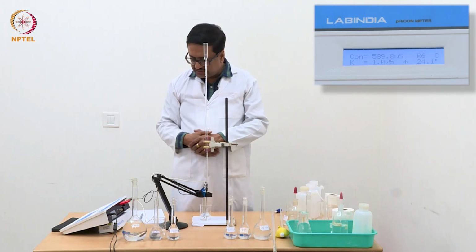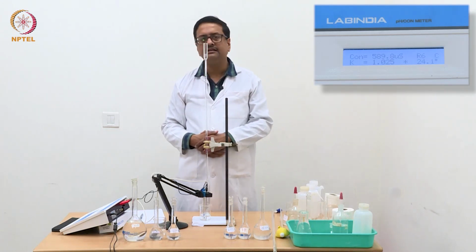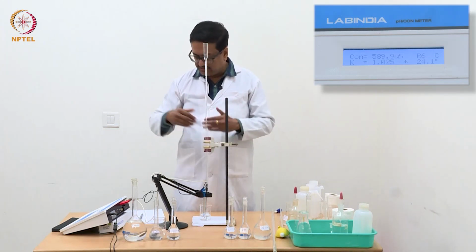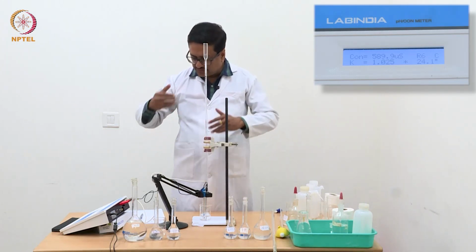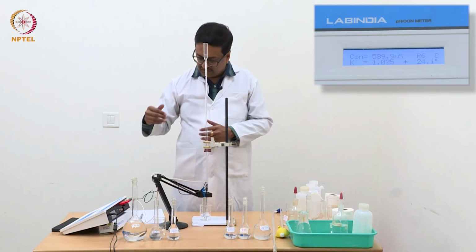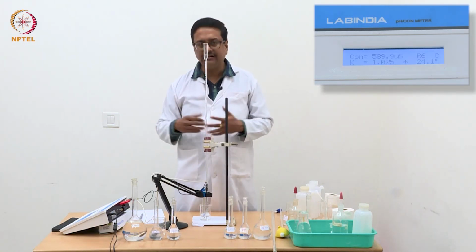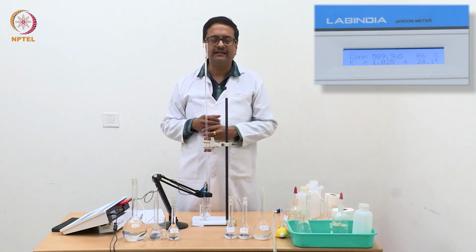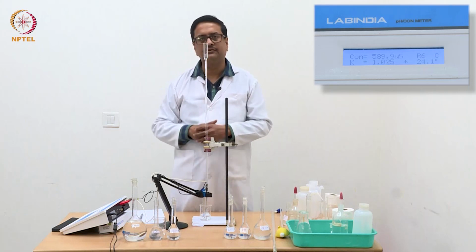If you see the difference between the initial readings, it was 782, then 740, difference is 40. 740 to 704 is again a difference of about 40. Then it is 673, the difference is like 30. Then 629, so 630, that means about 40.